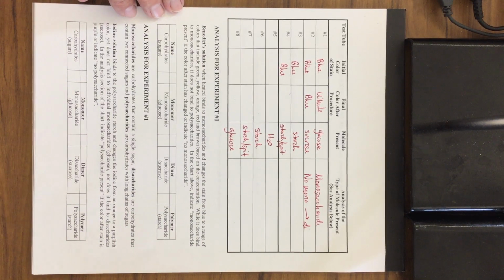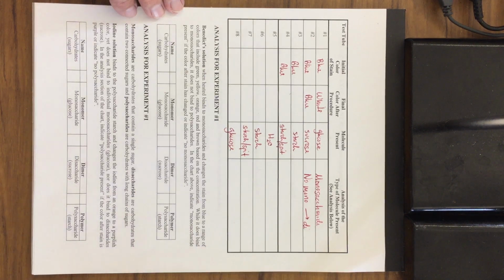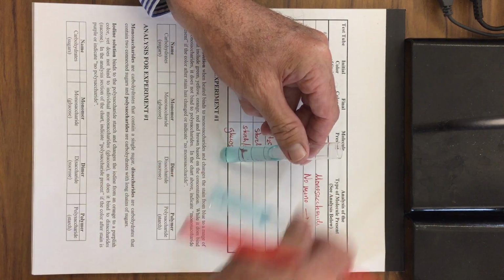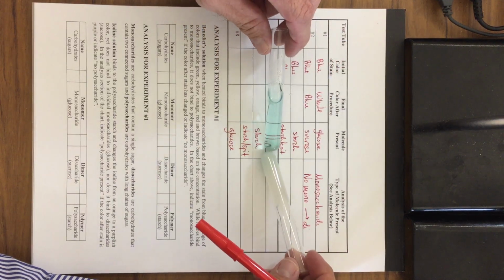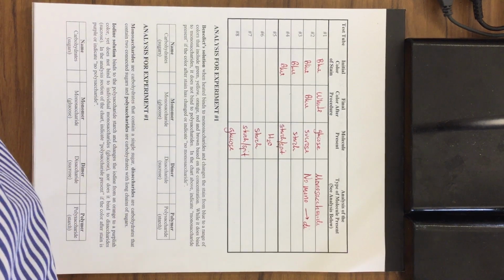The third test tube looks very similar to the first. This one was filled with starch. And notice that there's no coloration, no difference compared to this one right here, maybe a slight coloration difference. But the real difference is when we get to the last test tube right here, and we see that the one with the spit definitely changes color.